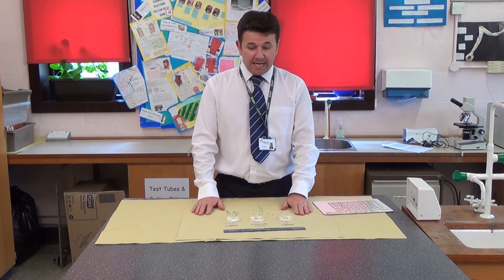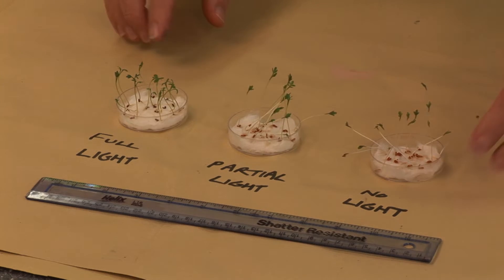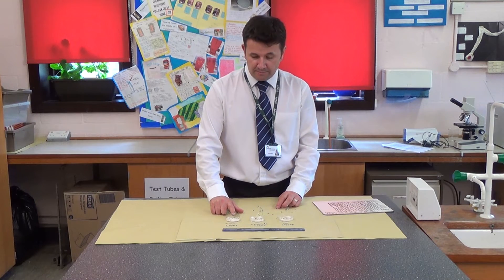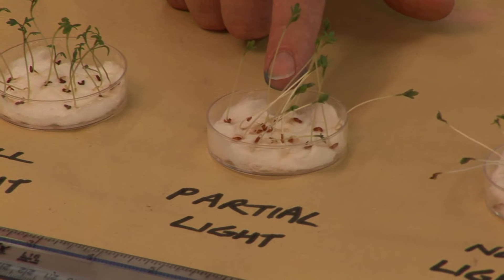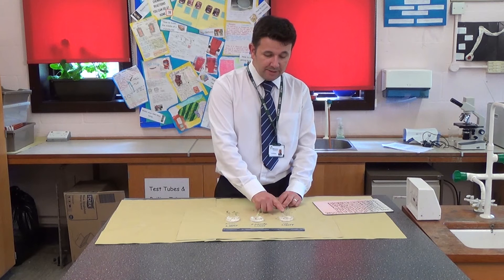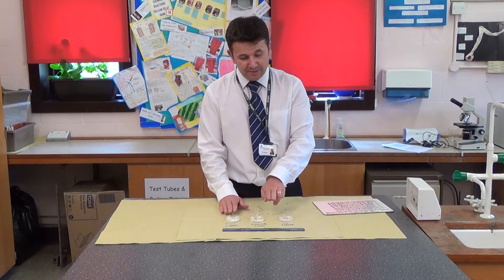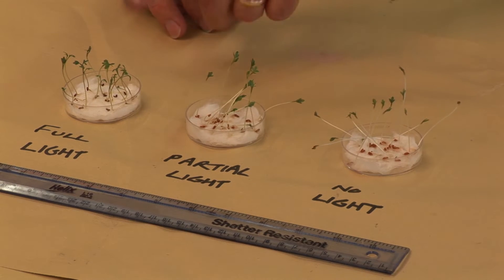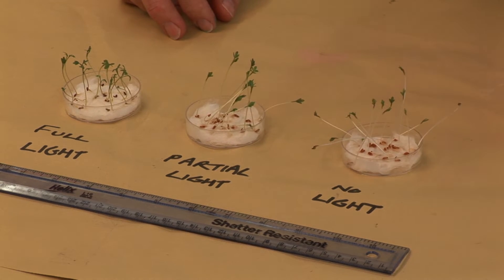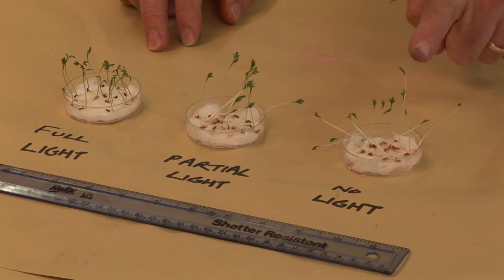Seven days later, the cress seeds have grown. This Petri dish was kept in full light, this one in partial light at the back of the lab, and this one was kept in a dark cupboard. You can immediately see a difference in heights. Surprisingly to most people, full light has the least height, then partial light, then no light — the dark condition produced the tallest seedlings.